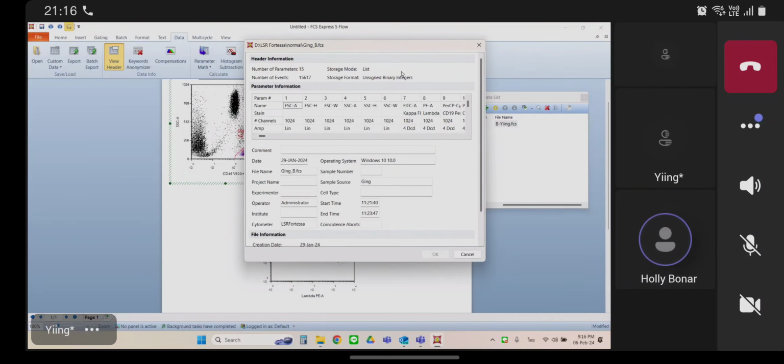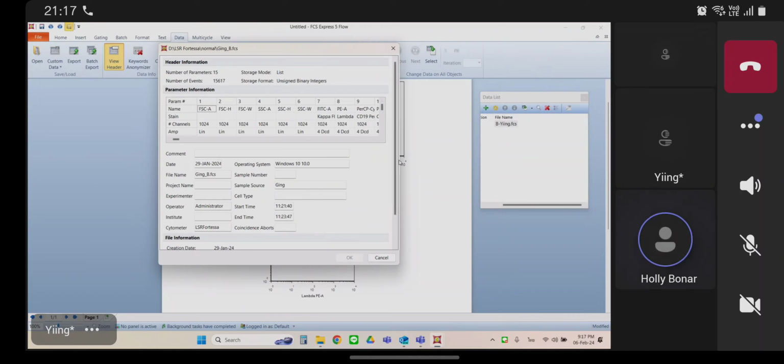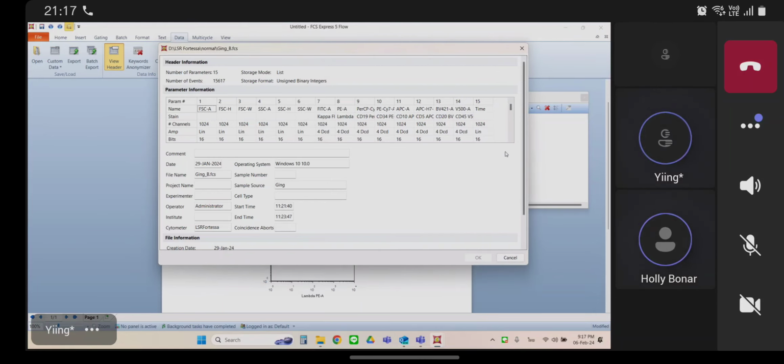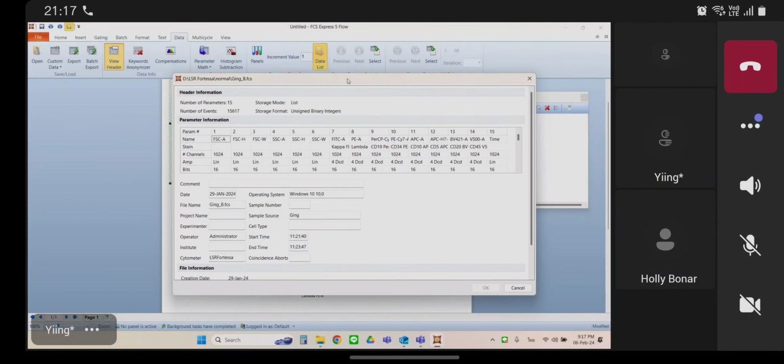Perfect. Click that. Okay. So in this data file, we have the 6 parameters at the top, right? Forward scatter area, height, width, side scatter area, height, width, and then kappa lambda. Okay. So go ahead and cancel. So now we know what that looks like. We have the 6 scatter parameters, and then kappa and lambda are 7 and 8. Yeah. Right. Okay. So go ahead and cancel, and then load your patient data.